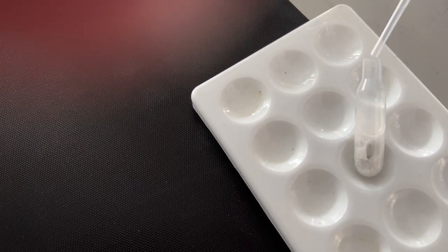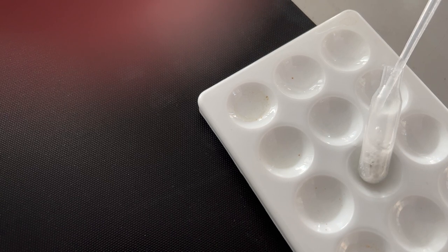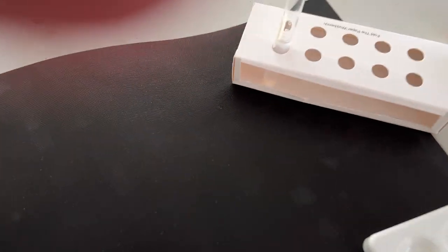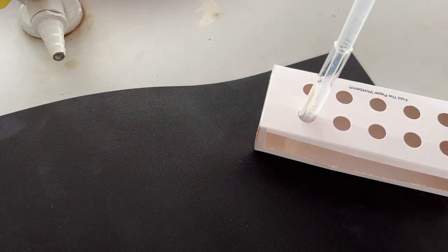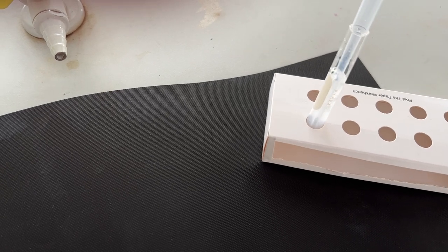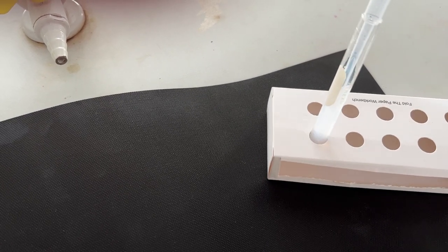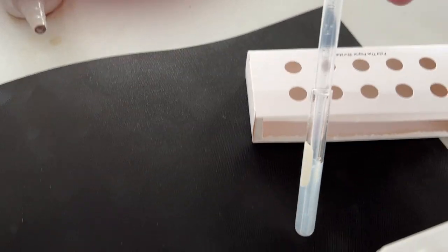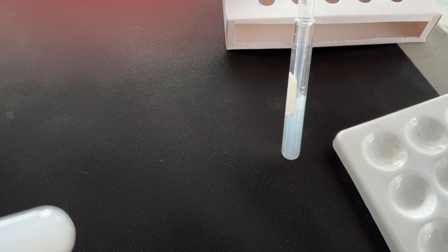Again, across to our reaction, sample some gas into our small tube and slowly bubble through. I think you can already tell that we've got the same milky color of the lime water there - positive test, but on a much smaller scale.